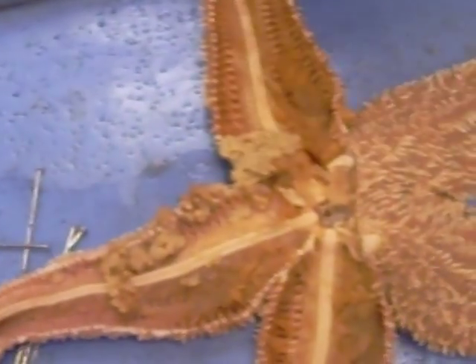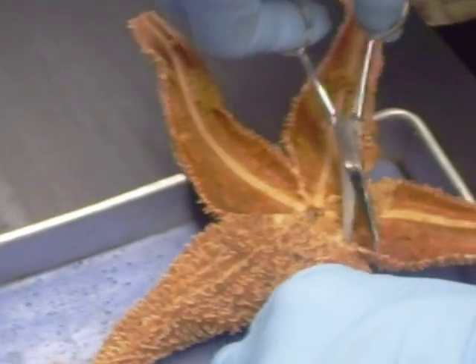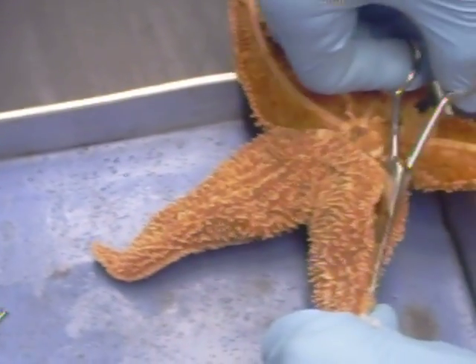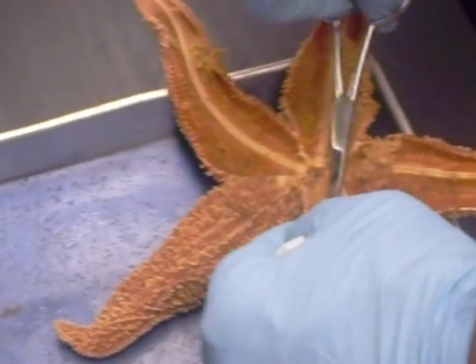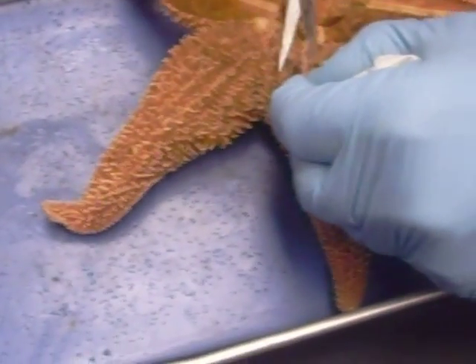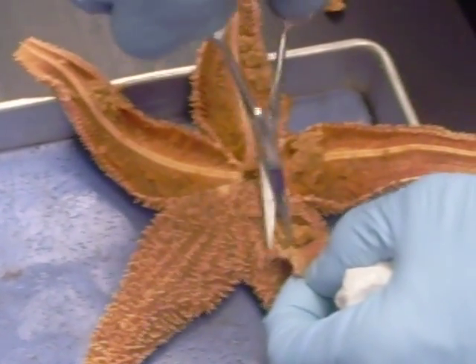What's this little ridge? I'm not going to pin out a bunch of small things. I don't have to worry about the ring canal or the stone canal.